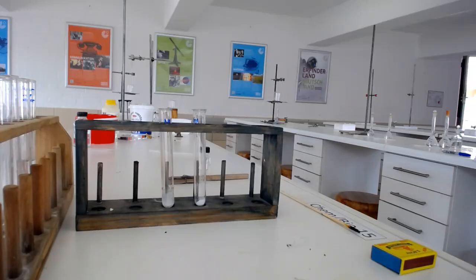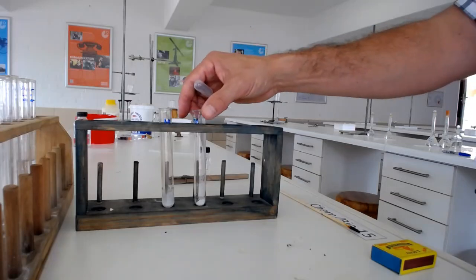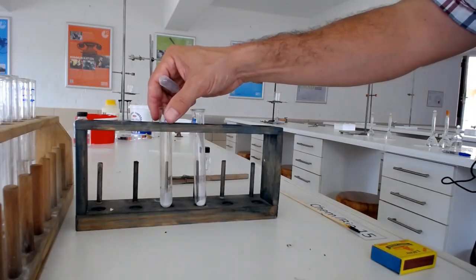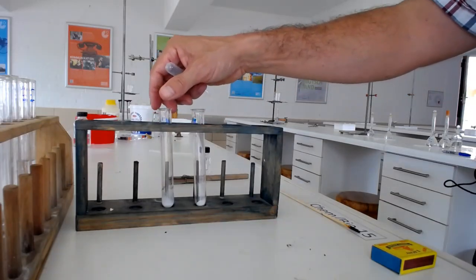Okay, so let's test for the difference between a nitrate and a nitrite. What I have here are two white powders.